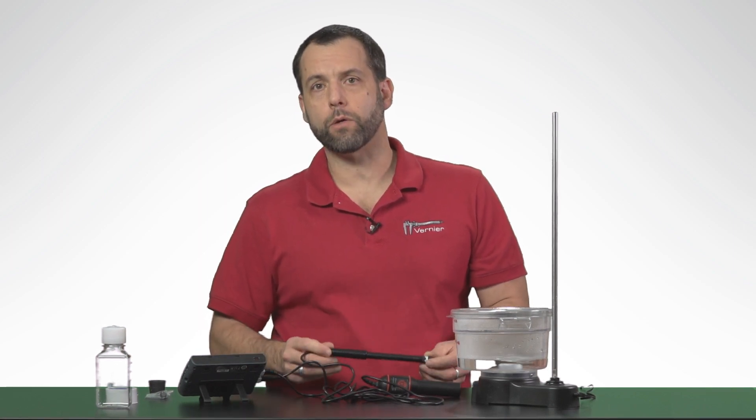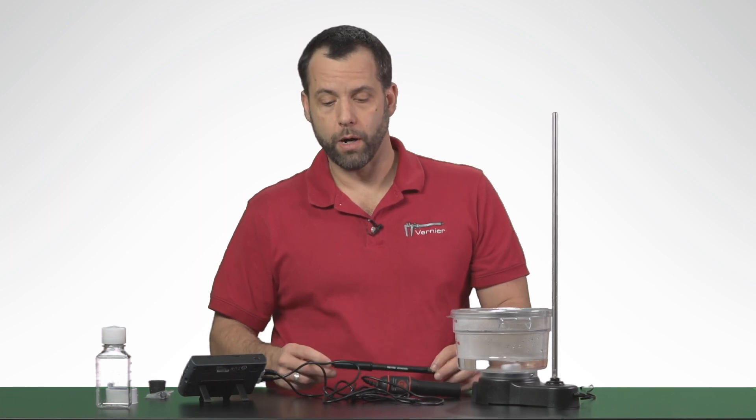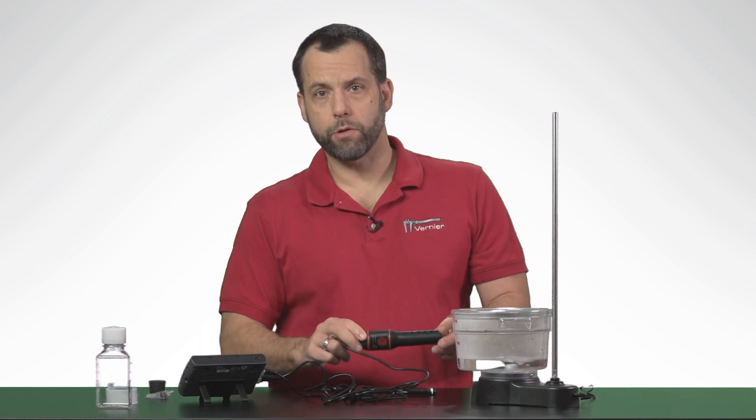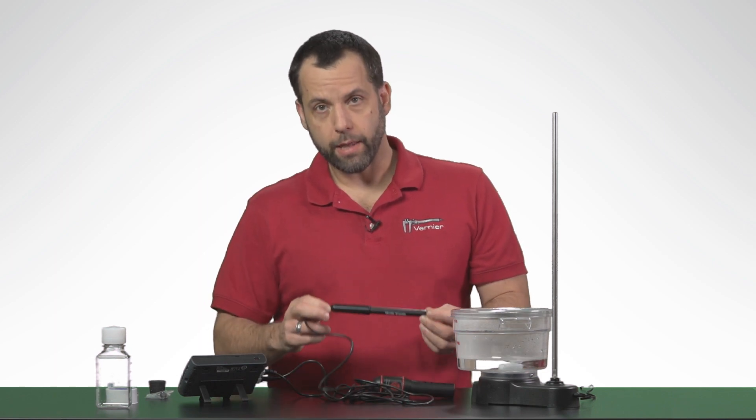This sensor is really designed to be used to monitor things like fermentation. That's really what it's best for. And that's actually what I'm going to show you next, is how to use this CO2 sensor and this ethanol sensor to monitor fermentation.